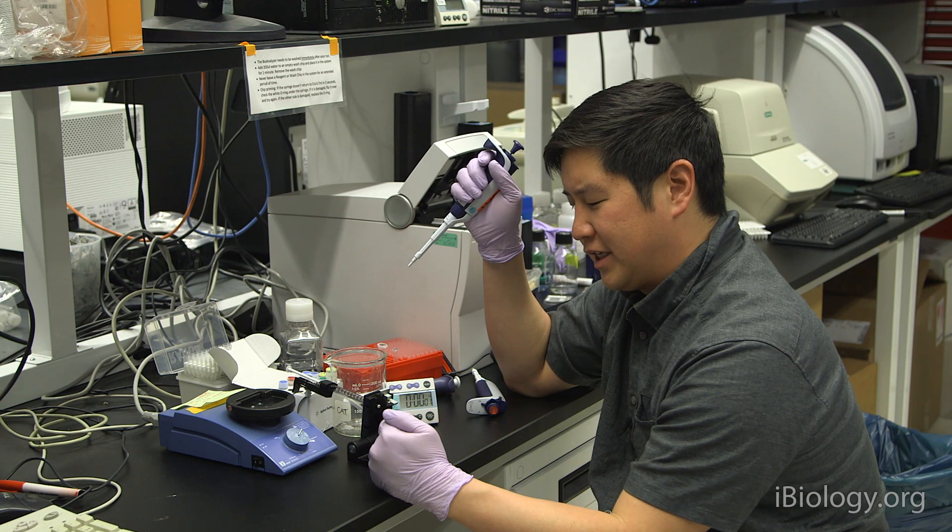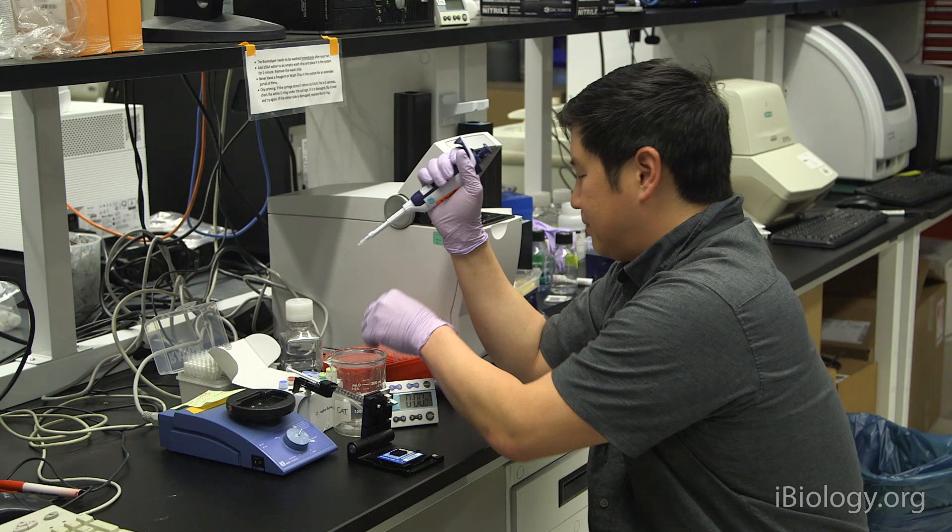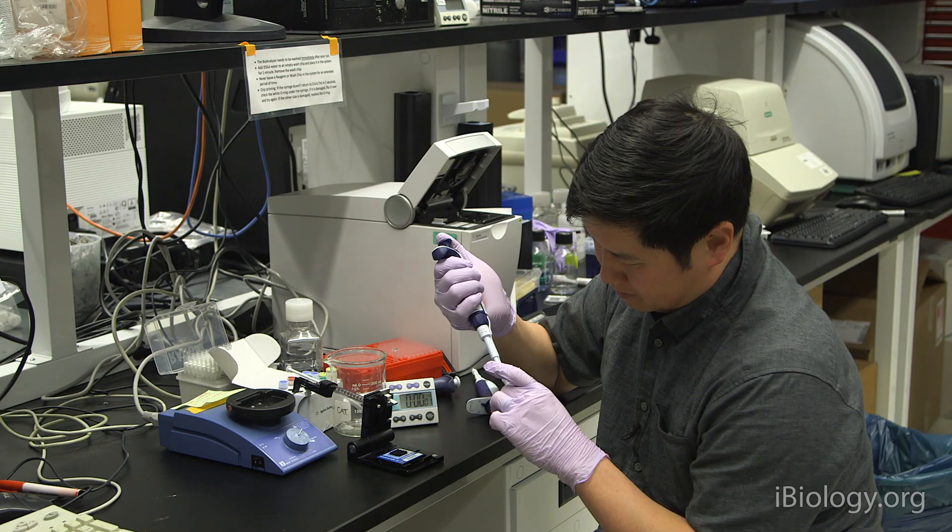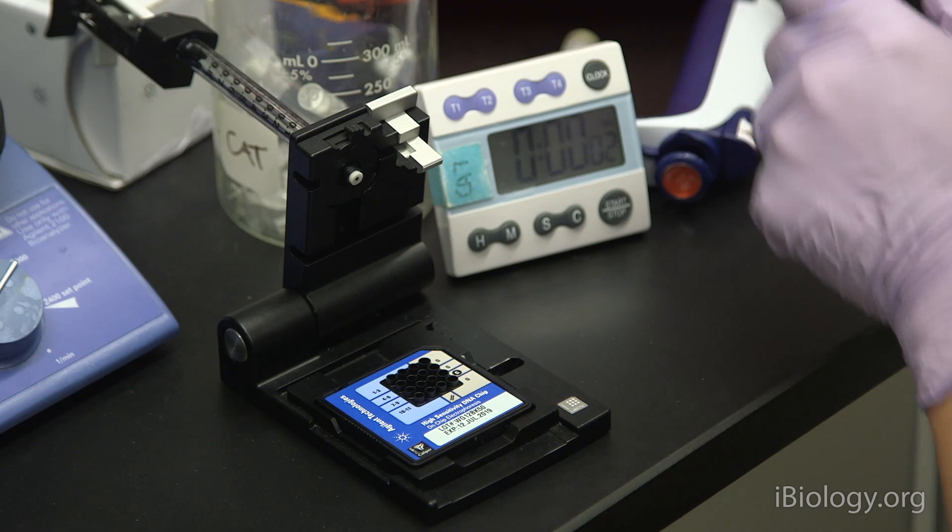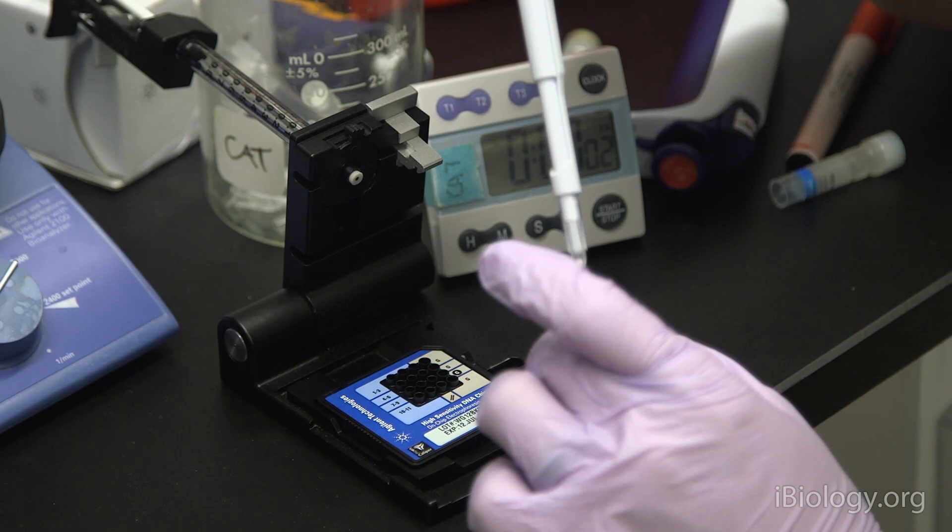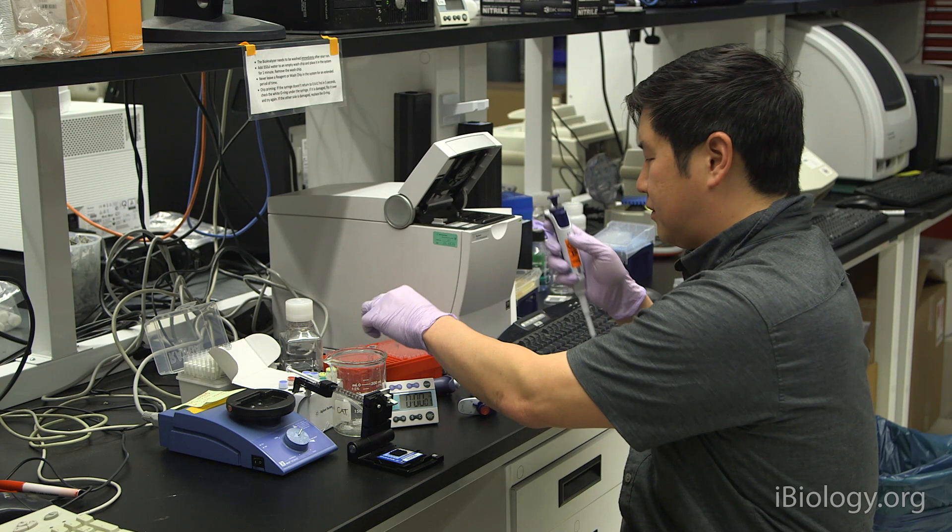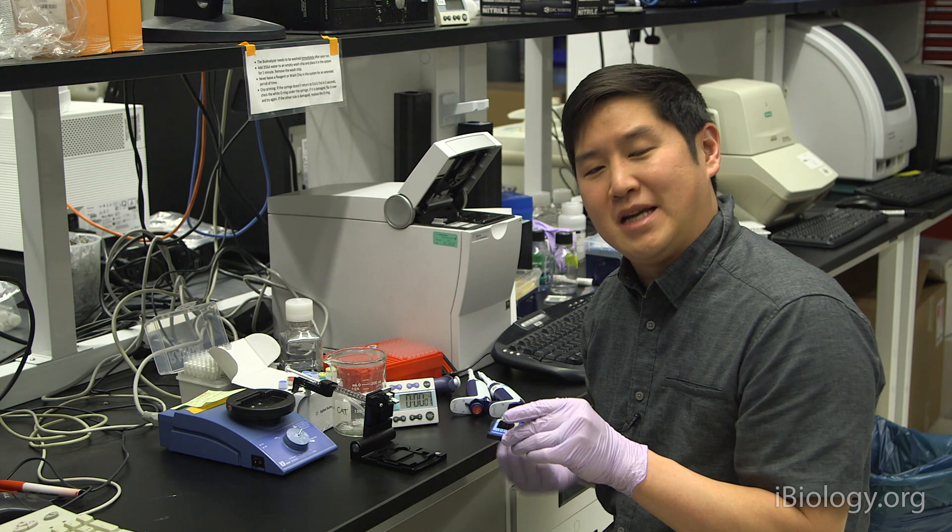Now we can add your samples. There are references to the well number that correspond to the sample numbers on the chip. I only have two samples, so I'm now done. But you can proceed with up to 11 samples on this chip.